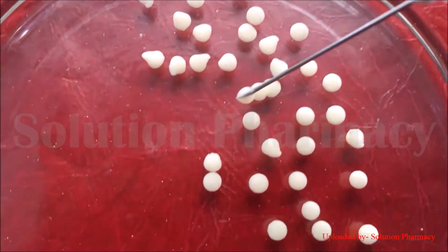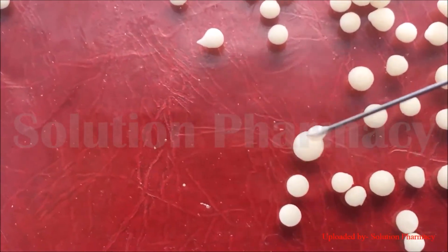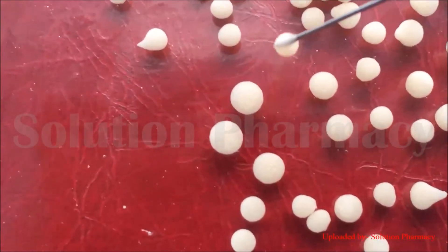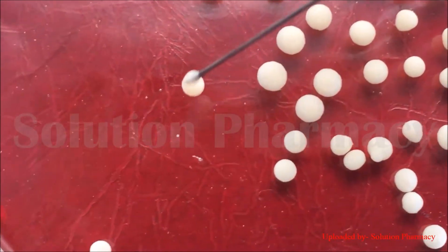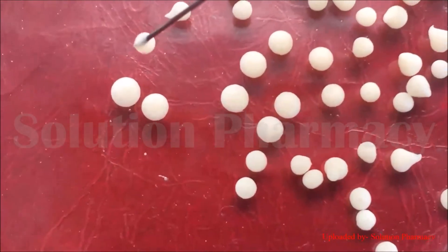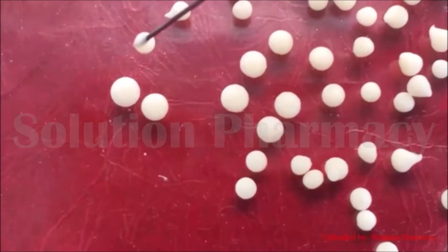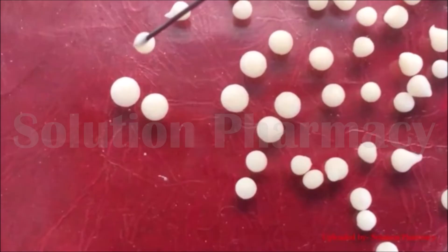The principle of this experiment is that alginate, commercially available as alginic acid sodium salt — commonly called sodium alginate — in the presence of a monovalent cation such as Na⁺, forms a viscous solution even at higher concentrations. This means sodium alginate is freely soluble in distilled or deionized water at room temperature (25°C).